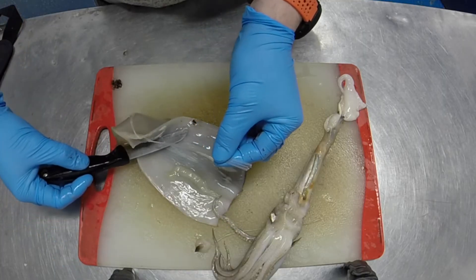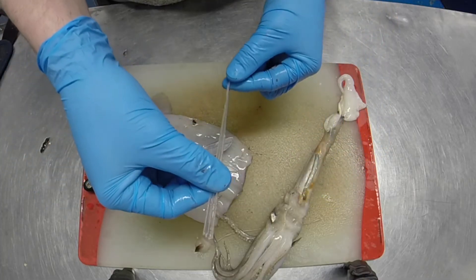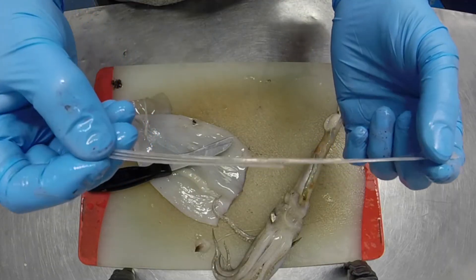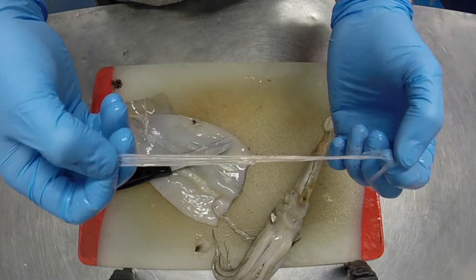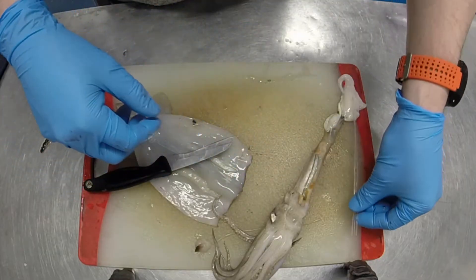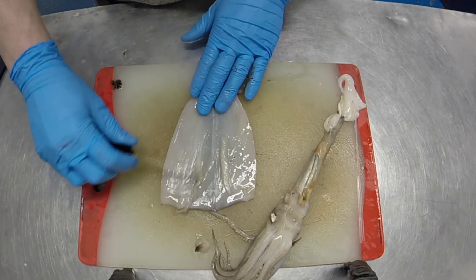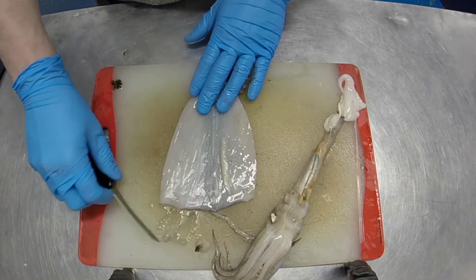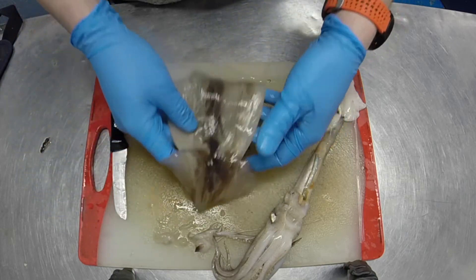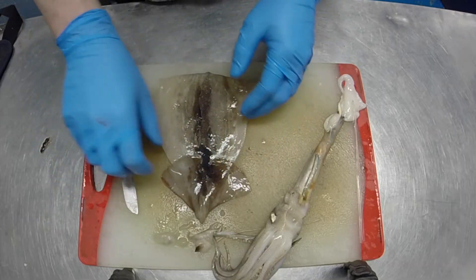This section I'm removing here is one of the most fascinating bits of squid anatomy — this is what's called a squid pen, and it's fairly rigid; it feels very much like plastic. I quite often kid with folks that they're eating all the plastic in the ocean, which is why the squid pen feels like plastic. Squid are in fact invertebrates, the same as octopuses and worms and slugs and snails, so they don't have a backbone, but they do have this squid pen that allows them to remain fairly rigid.